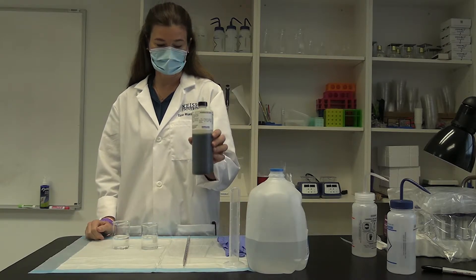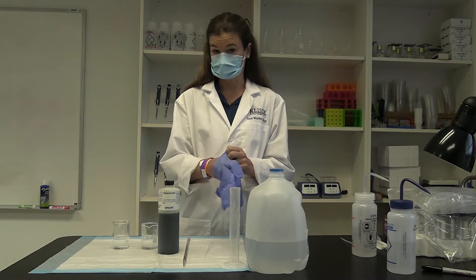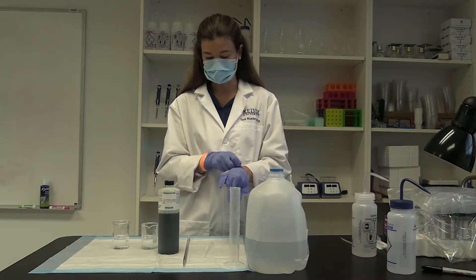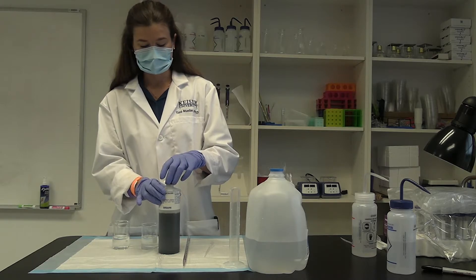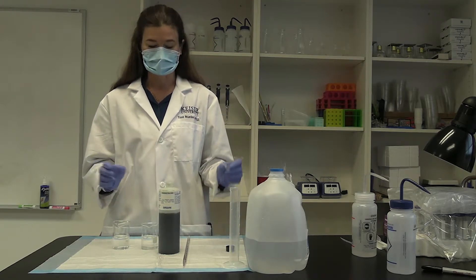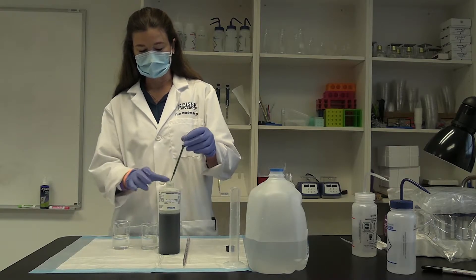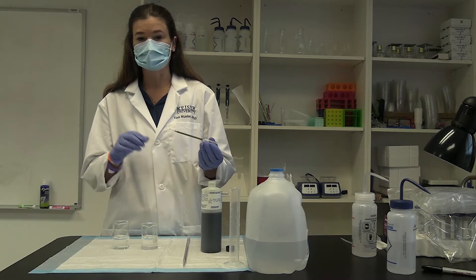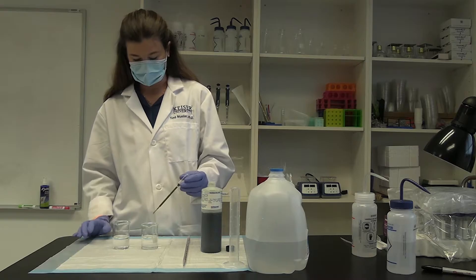We're going to add the bromothymol blue, and if you want to, you can wear gloves to do so, maybe you don't want to get all blue on three fingers afterwards. In the instructions I think it says eight drops. If you feel that that is not enough because it's not blue enough or the color is not strong enough, then just add more drops, but make sure that it's the same number of drops in both.